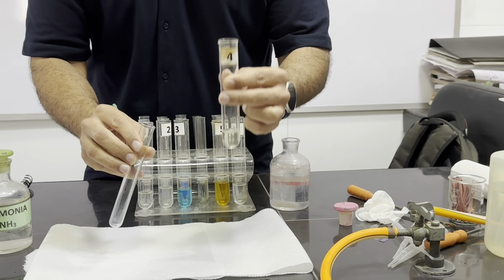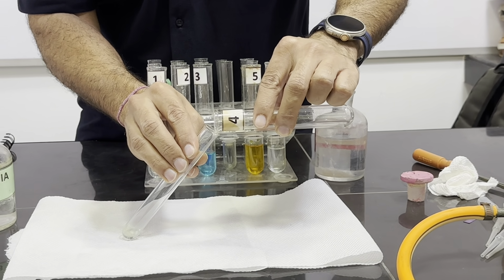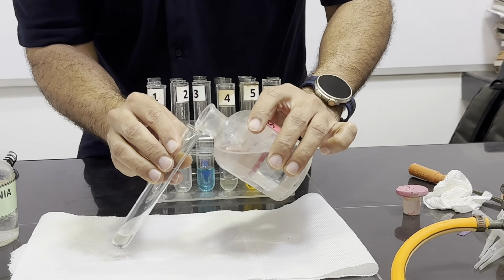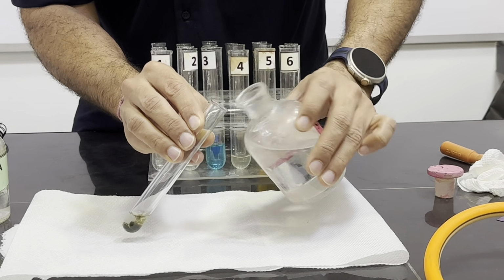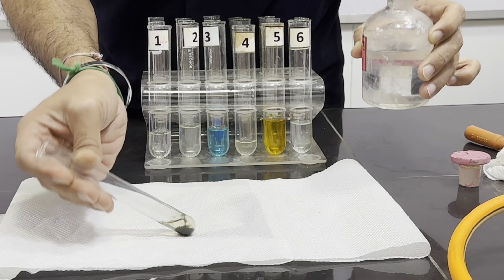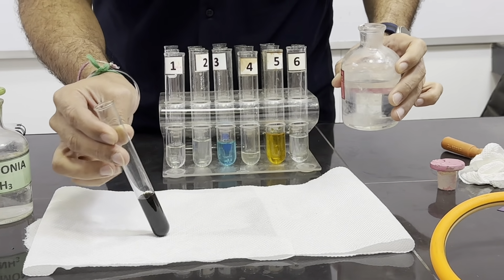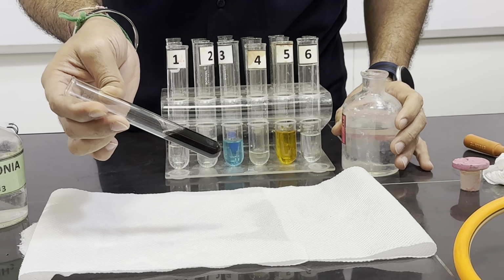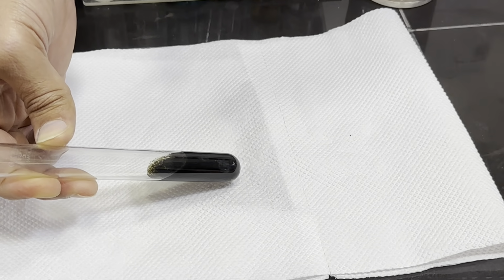We are going to test this fourth chemical now. We will take 1 centimeter depth of the solution first, and now we will test this with sodium hydroxide. Few drops first. We can see green colored precipitates are formed. And then we will add this in excess. The green precipitates remain insoluble, and we can see clearly the precipitates are insoluble. Precipitates can be seen from the top.